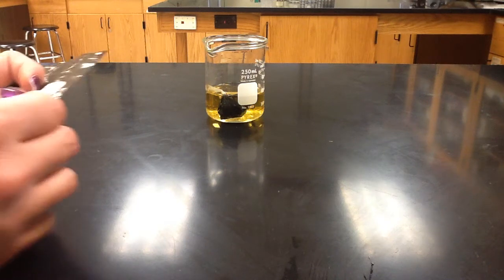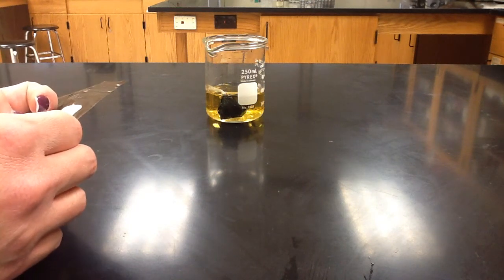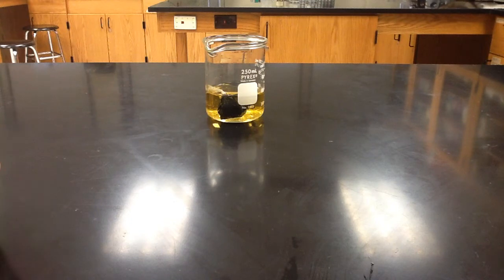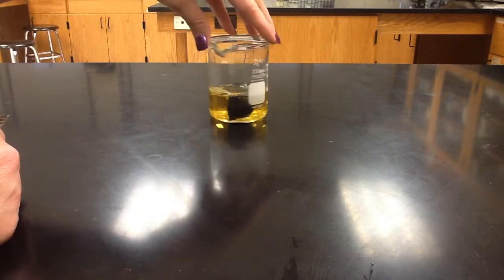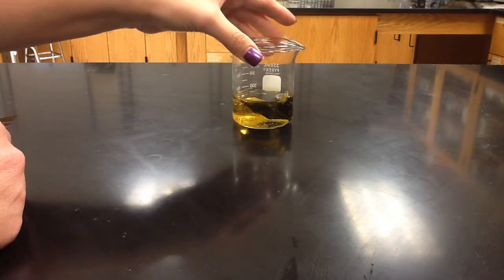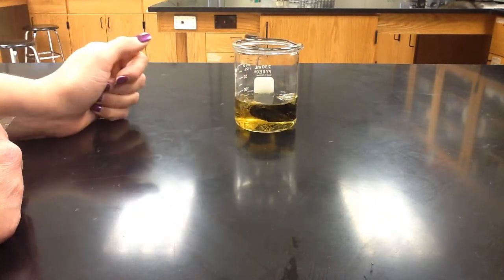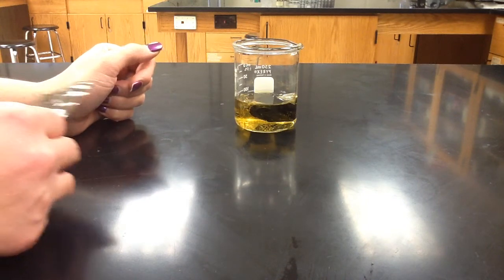So this is the final observations for the iodine lab, the diffusion lab, and what you can see here is this is our tube that has been sitting in our beaker for 30 minutes, and we're going to be looking at each individual part.